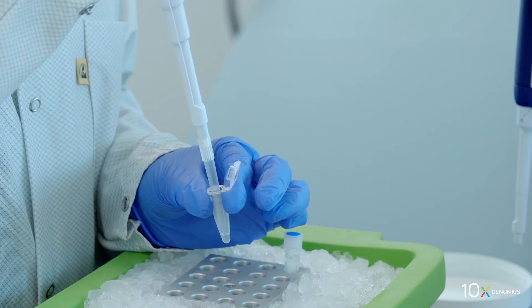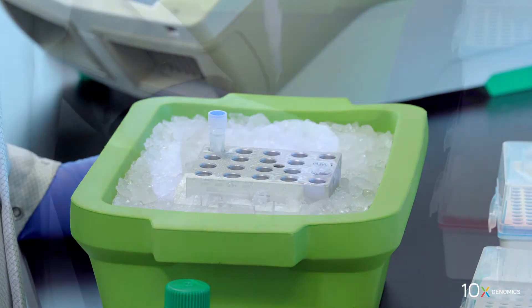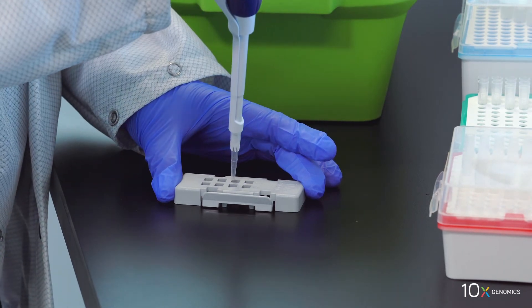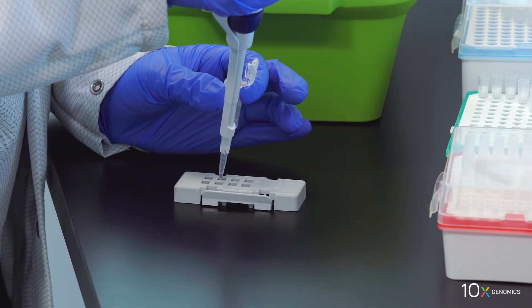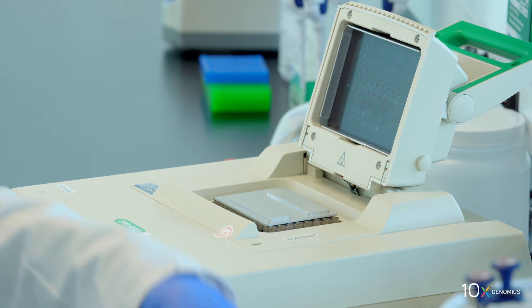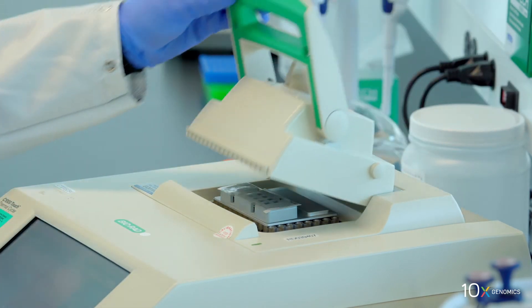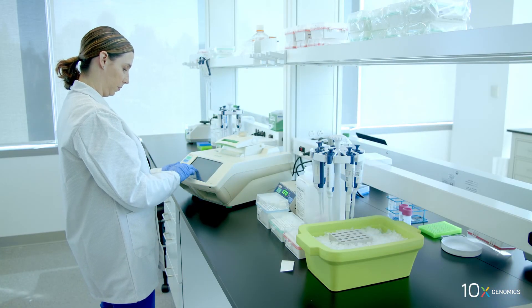Pipette mix 10 times and centrifuge briefly. Remove 0.1x SSC buffer from each well, add 75 microliters RT master mix to each well. Apply the slide seal on the slide cassette firmly and place the slide on the thermocycler adapter on the preheated thermocycler. Close the thermocycler lid and skip pre-equilibrate to initiate reverse transcription.